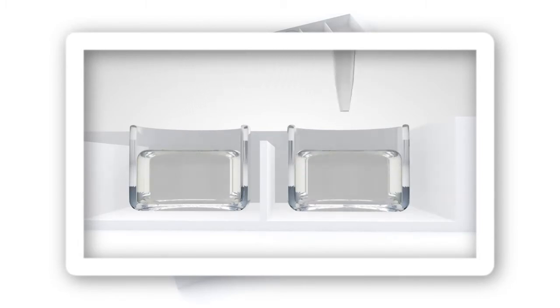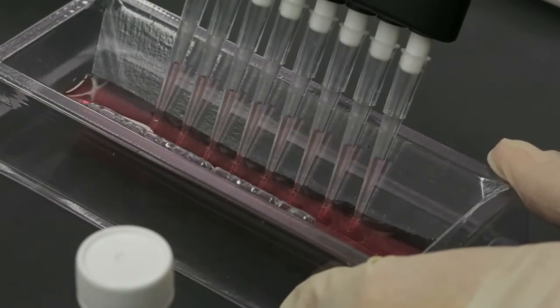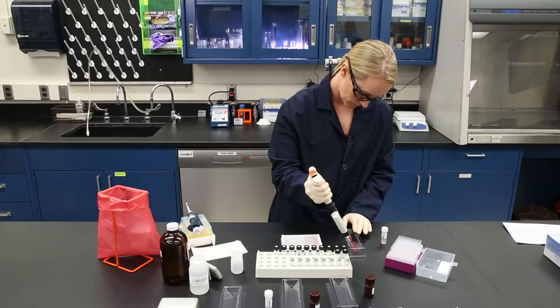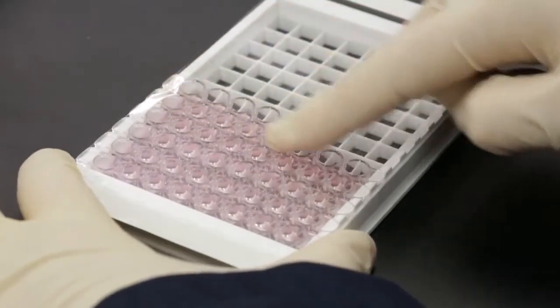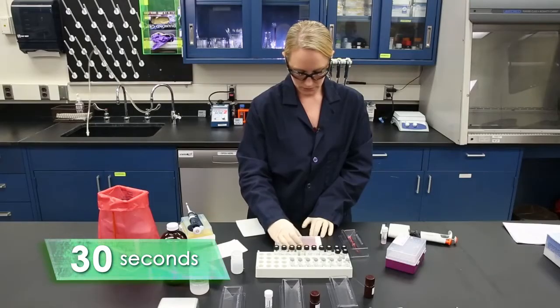The accuracy of ELISA depends on the analyst technique, including pipetting sequence, accurate reagent volumes, and consistent incubation periods. Being careful not to touch the bottom of the well, load the ELISA plate with duplicate 50 microliters of standards, quality controls, and samples into their predetermined well locations. Add 50 microliters of the antibody solution to each well with a multi-channel pipette. Cover the wells with adhesive film and mix the contents with a rapid circular motion for 30 seconds. Be careful not to spill the contents.